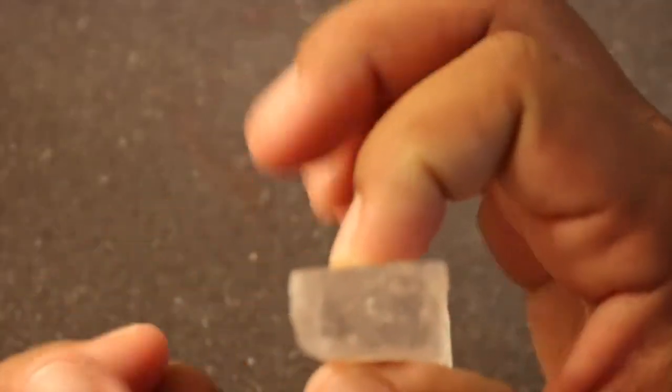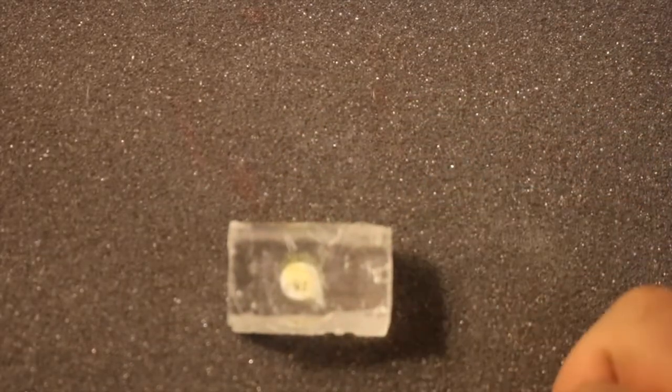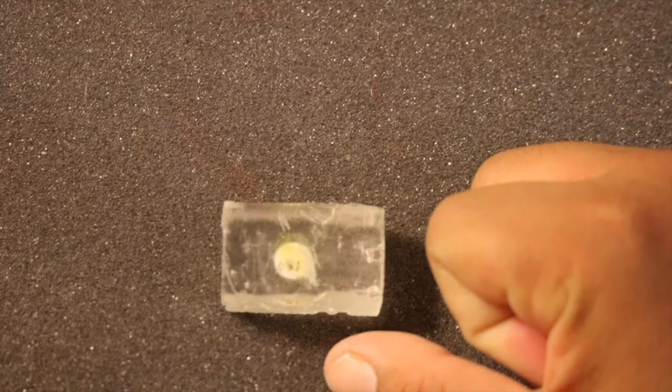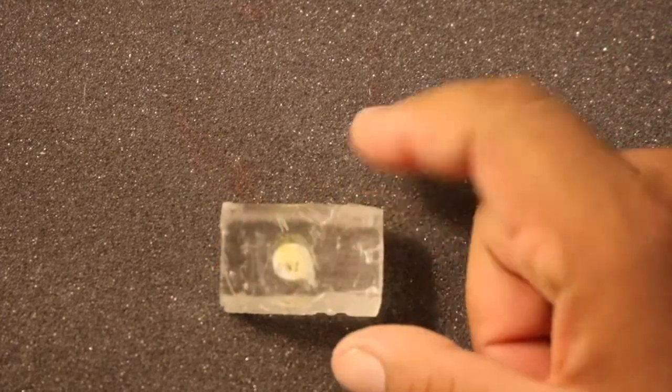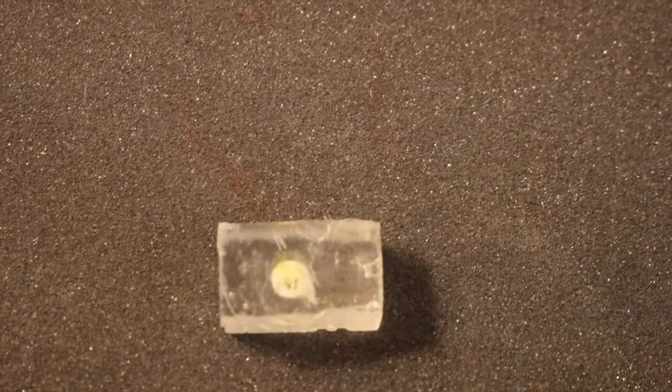What about this last one? And again, a smooth surface and a smooth surface. So this mineral right here has 3 directions of cleavage. They're at 90 degrees to one another. So now I know that this mineral has a non-metallic luster, a hardness of somewhere around 2.5 to 3, and it has 3 directions of cleavage that are at 90 degrees to one another.